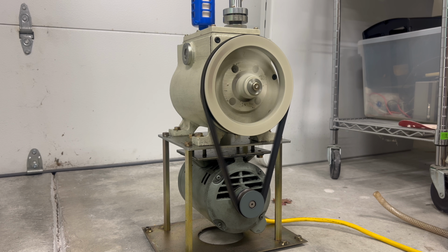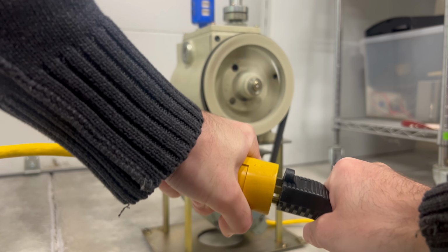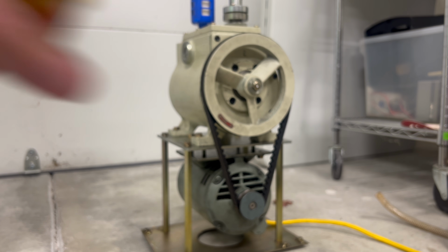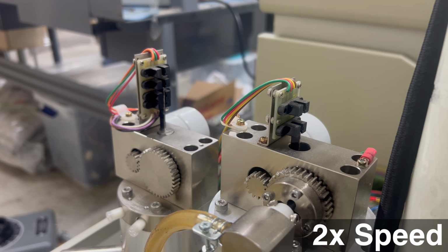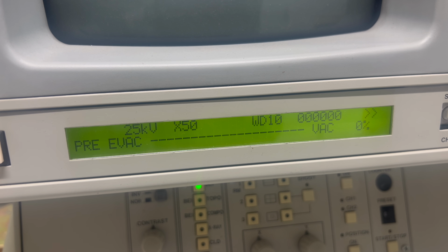I started by testing the pump alone and verifying that it reached about 10 millitorr, which is not fantastic, but sufficient and probably expected for a pump this old. Moving forward, I'm only going to connect the roughing pump and keep the diffusion pump off. This means that our lowest vacuum should be roughly 10 millitorr, assuming we have no significant leaks. I turned the vacuum pump on and used the manual controls to open the valve and evacuate the chamber, but the pressure readout on the LCD didn't change. Odd. Perhaps the gauge is broken?